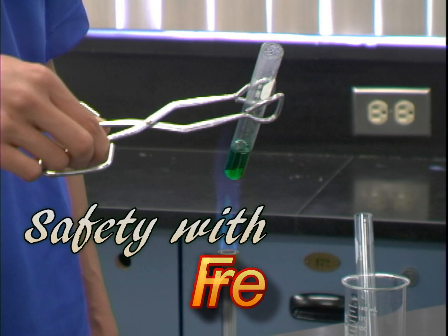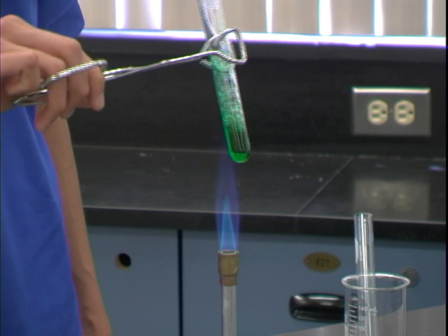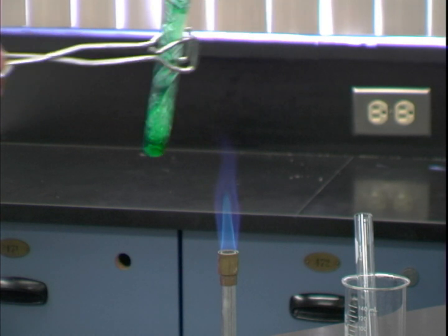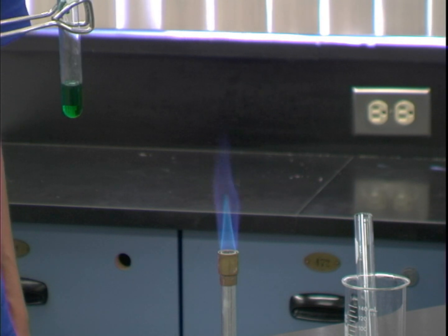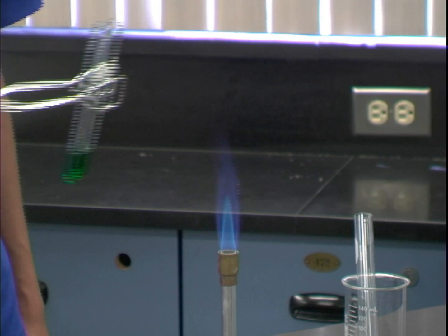Basically, fire is hot, and your skin does not like hot. Use protective clothing for hot equipment. Open flames also don't mix with skin or clothes, so never reach over an open flame. Don't mix flammable materials with fire. They are called flammable for a reason. They catch on fire. Don't throw away lit or burning things. They can catch the trash on fire.